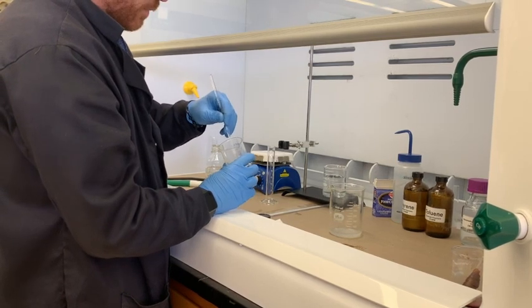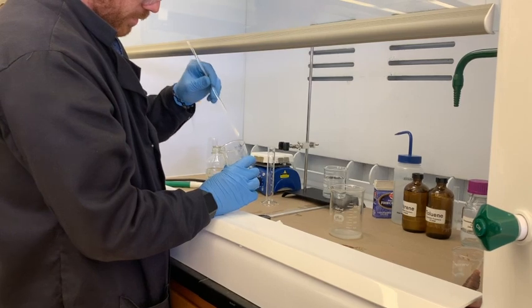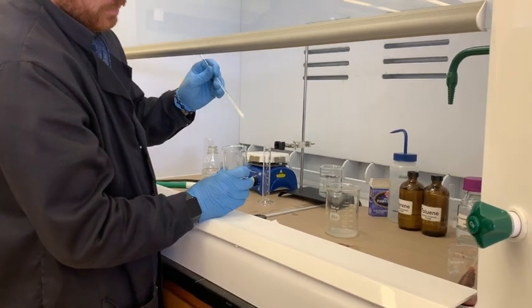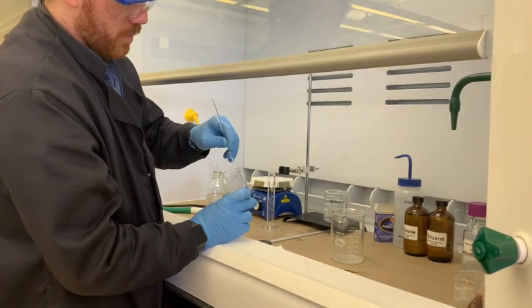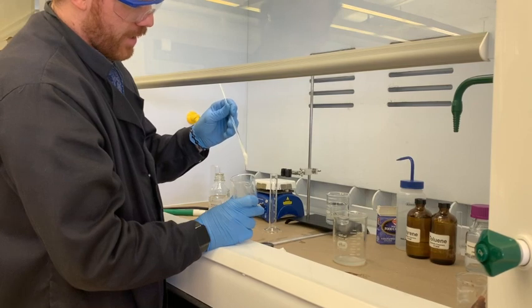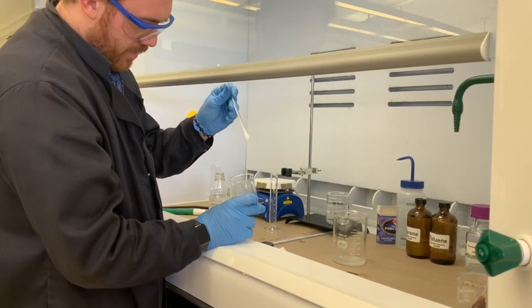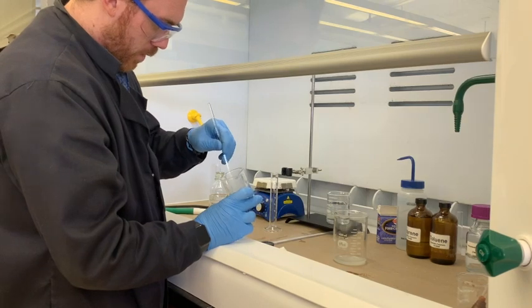Pretty icky stuff so far. But man, if I was a six year old kid, I'd think that this was amazing. Look at that. Just gooey slime. What a mess.